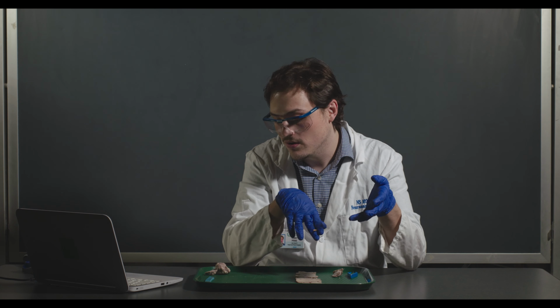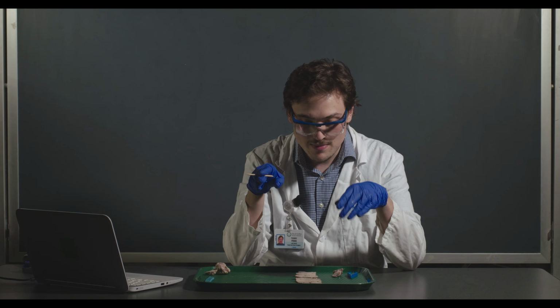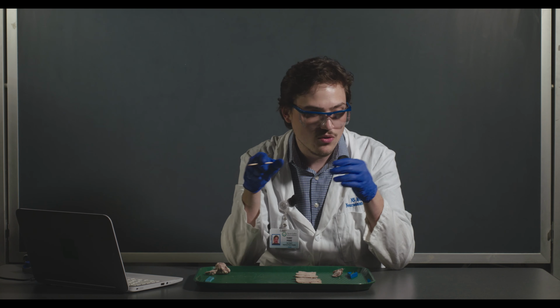All of the structures that I pointed out on these coronal sections and on the ventral and dorsal surface of the sheep brain and the mid-sagittal cut are found in your lab manual. Any quiz materials or lab practicum materials are going to use the actual images that are in the practicum, or maybe a really nice fresh image of one of these specimens here. So use the lab manual to study. That's the best thing that you can do for preparing for the lab quiz or the practicum.